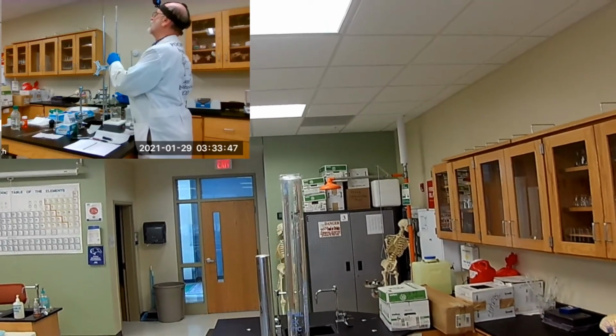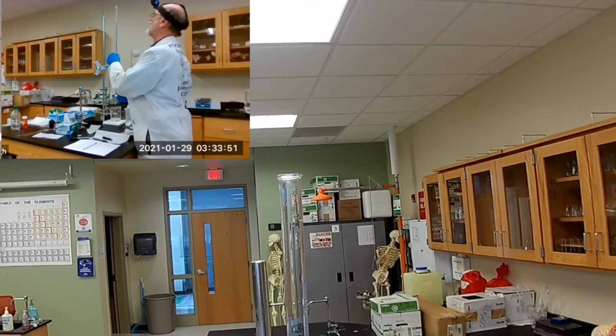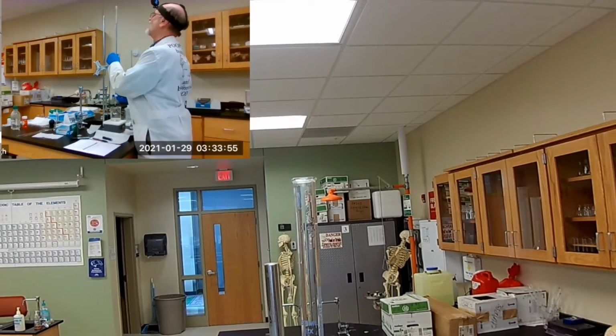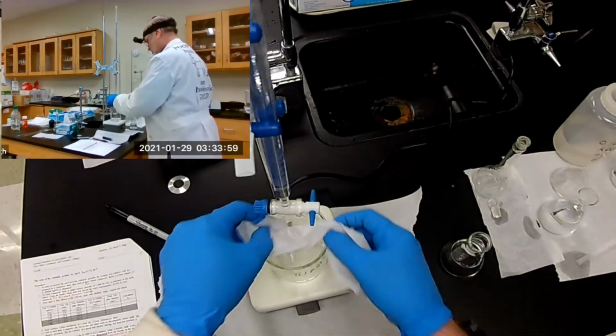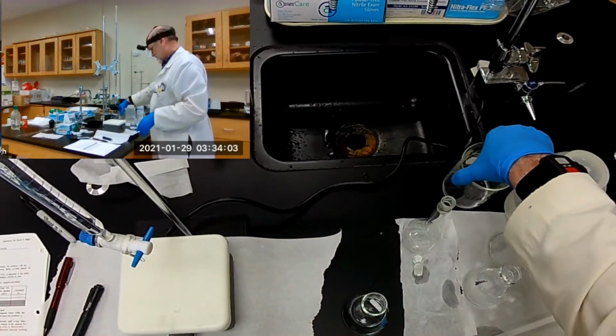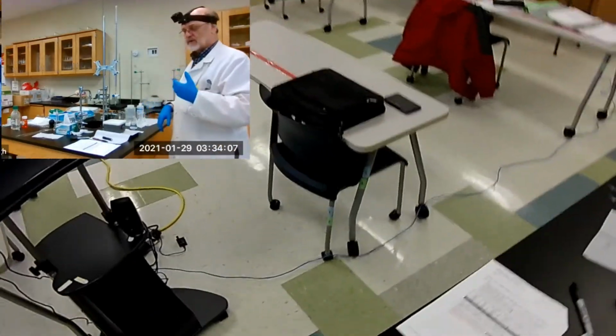I have to go down to 2. And there. Okay, so now we're primed and ready to go again. So I'll do that subtraction in my head. When I say we've got a 1/2 mil delivered, I've already made the calculation in my head.